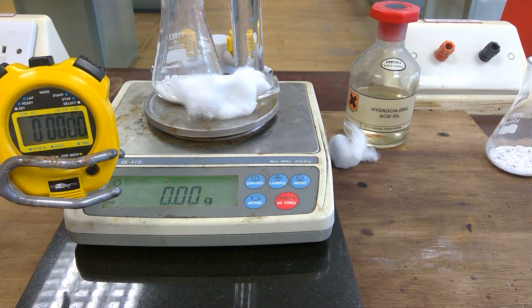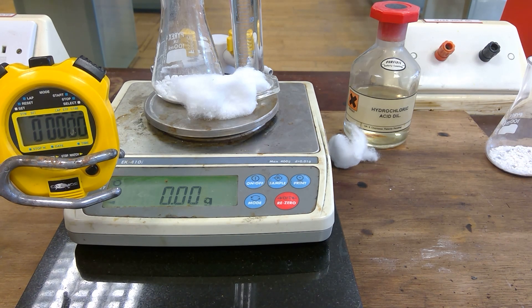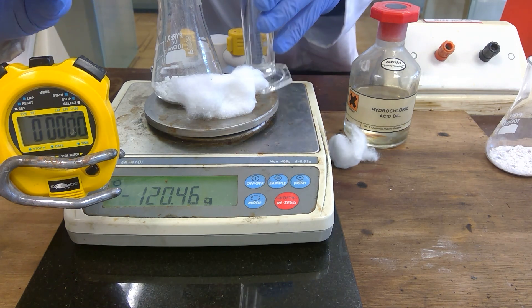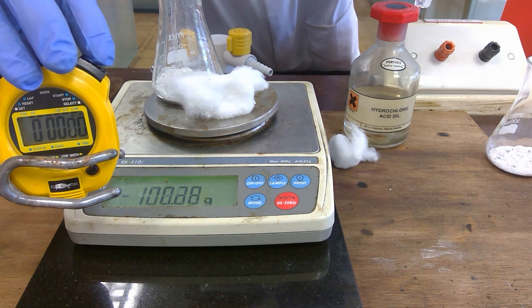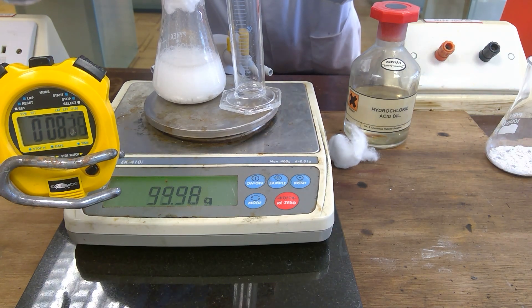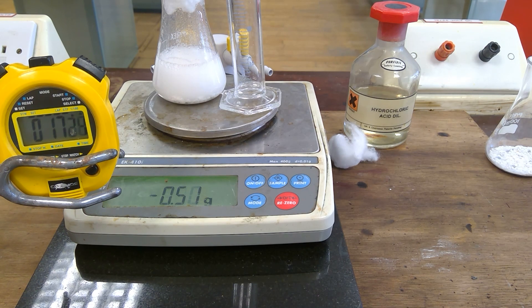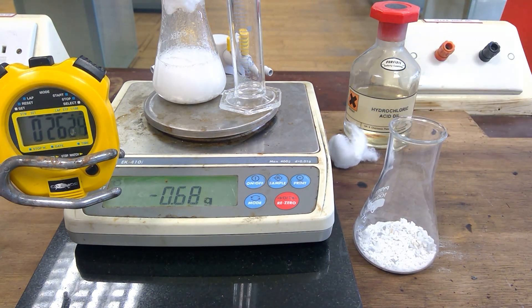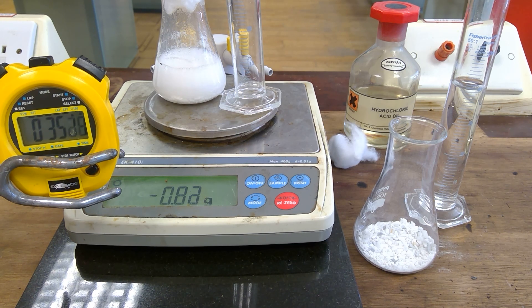Your job again is to take a recording at 30 seconds and every 15 seconds thereafter of the mass loss. Check that it's absolutely zero. Here we go, including the cotton wool into the top.